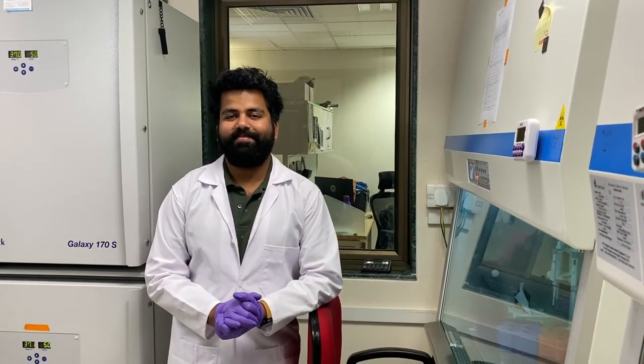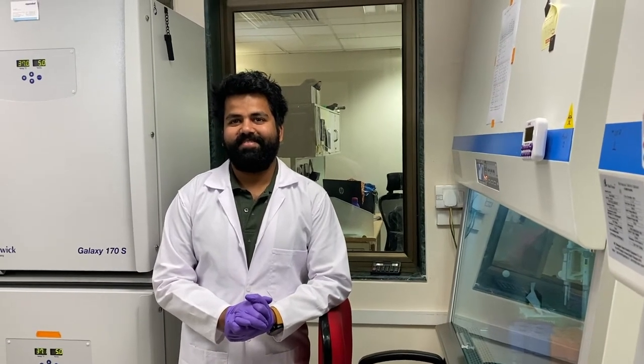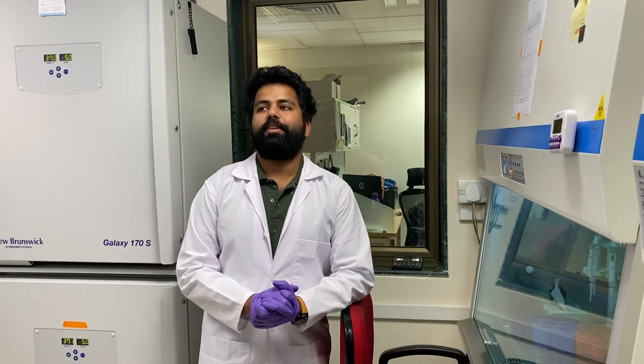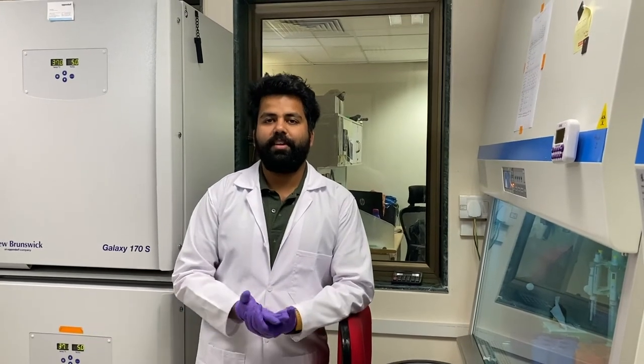I couldn't make out what you were doing here. I know it's called cell culture but what exactly are you doing? So as you read outside, this is the cell culture facility, and what we basically do here is culture cells.